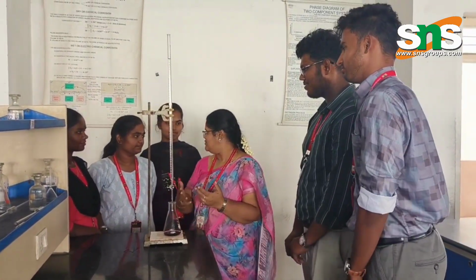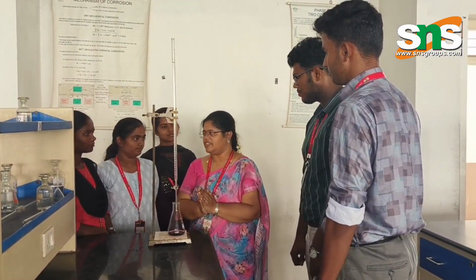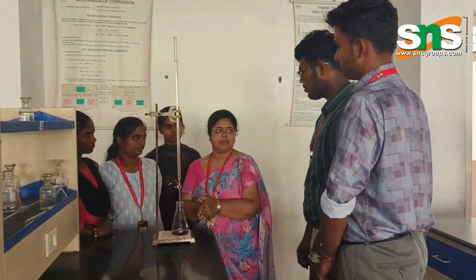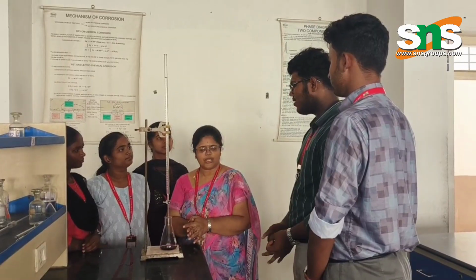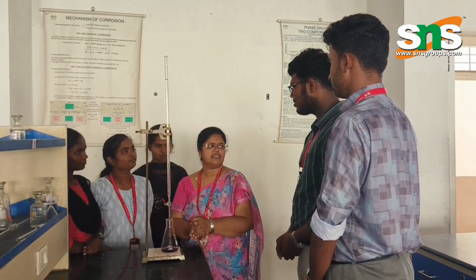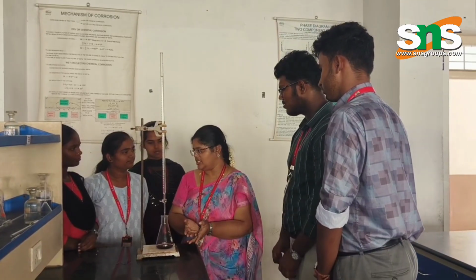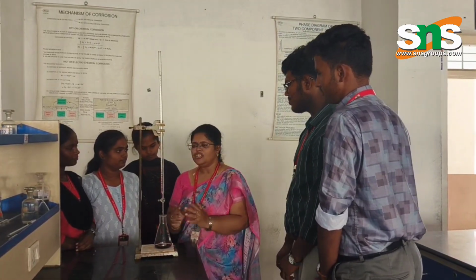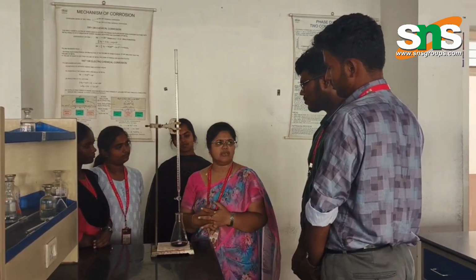Okay, today we are going to see about hardness. We are going to estimate the hardness in the water sample, right? Do you have any idea about water quality parameters? Yeah, tell me. pH, alkalinity, odor, taste, BOD, COD, hardness. BOD is biological oxygen demand, COD is chemical oxygen demand. All these parameters we combine together to assess the water quality.